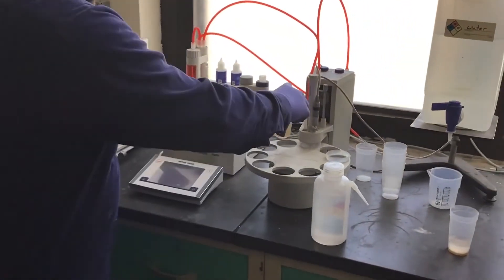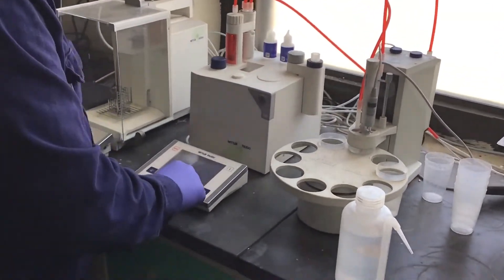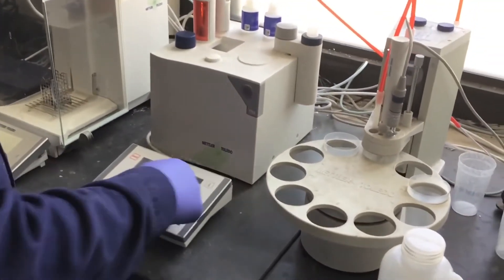Using these techniques and best practices, you can get both accurate and precise acid titration data that can help you save on your acid costs.